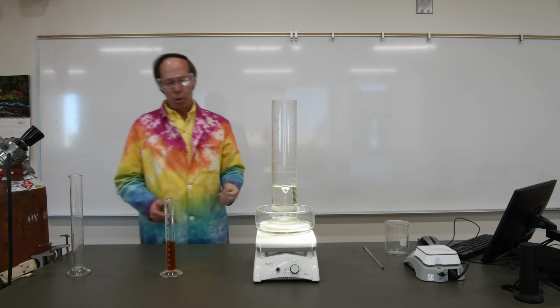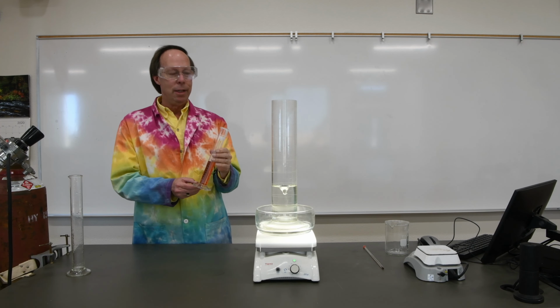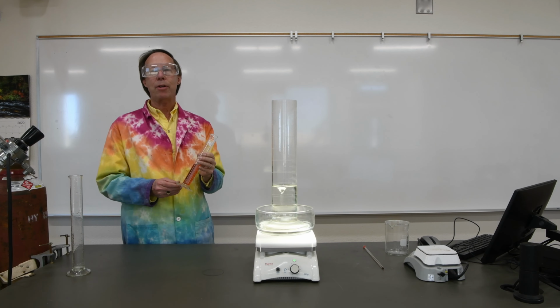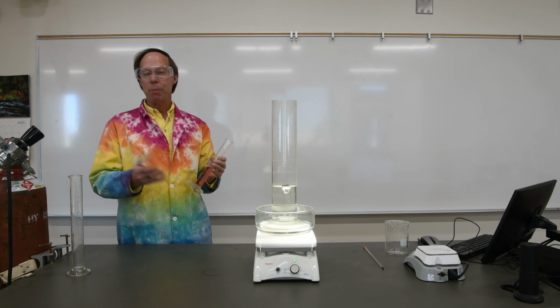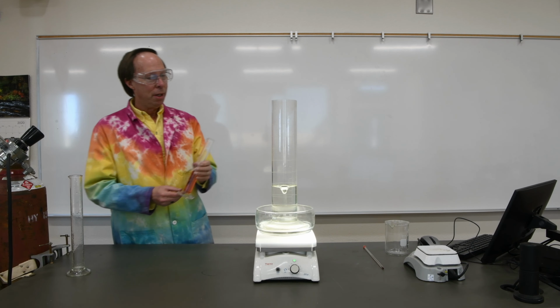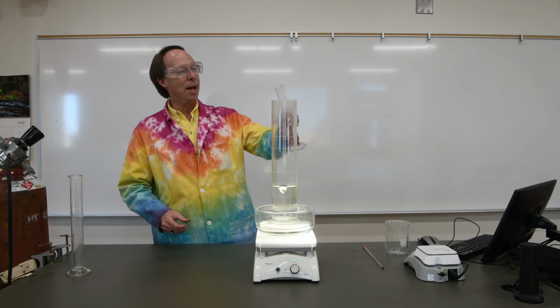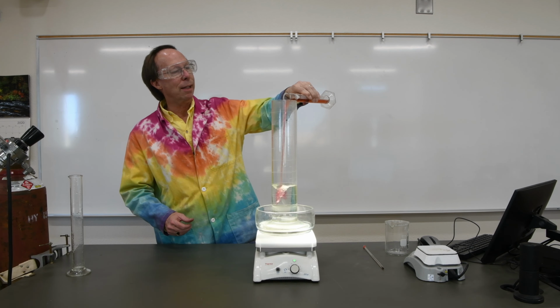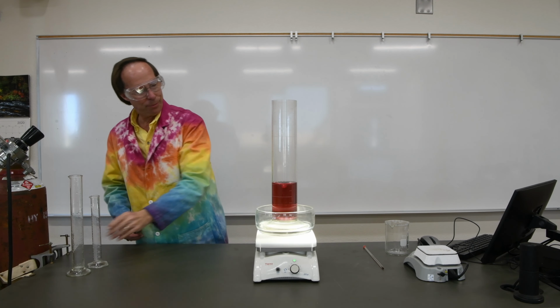And that something is called a catalyst. We have a catalyst here called cobalt chloride. Now the neat thing about catalysts is they are not destroyed in chemical reactions. They help the chemical reaction along, but at the end they can be recovered in their original form. And we're going to be able to see what's happening by looking at the various colors in the reaction. So watch carefully what happens to our bright pink cobalt catalyst once the reaction begins.